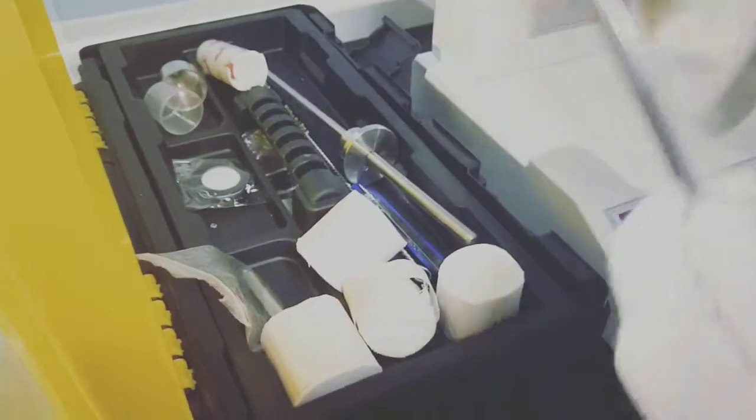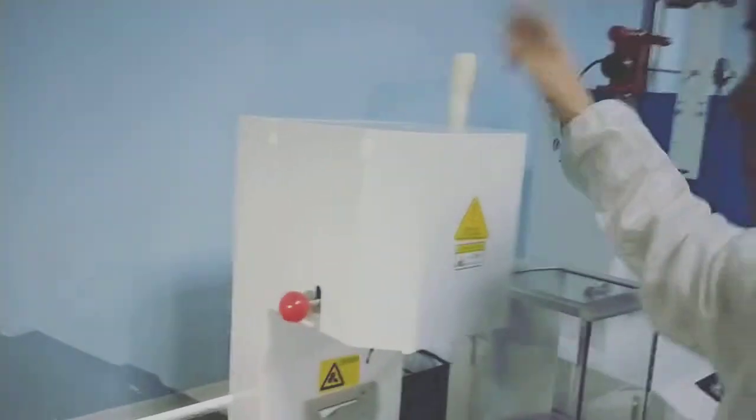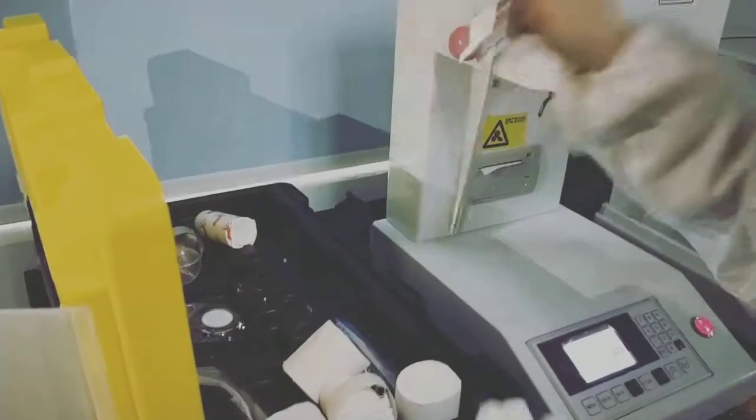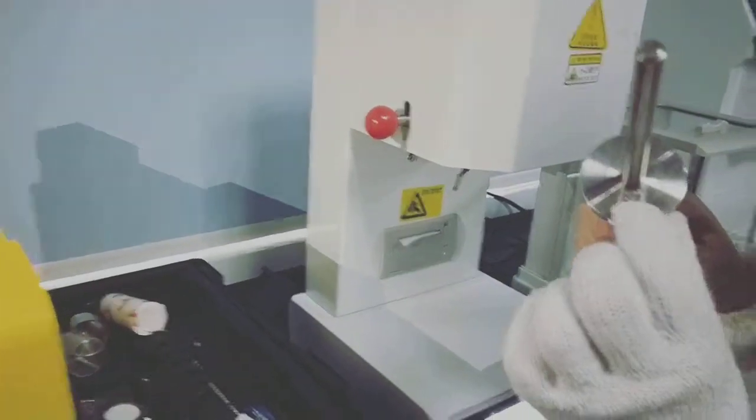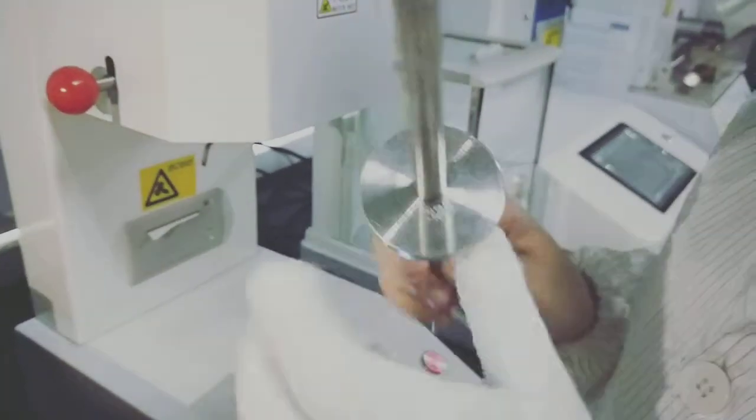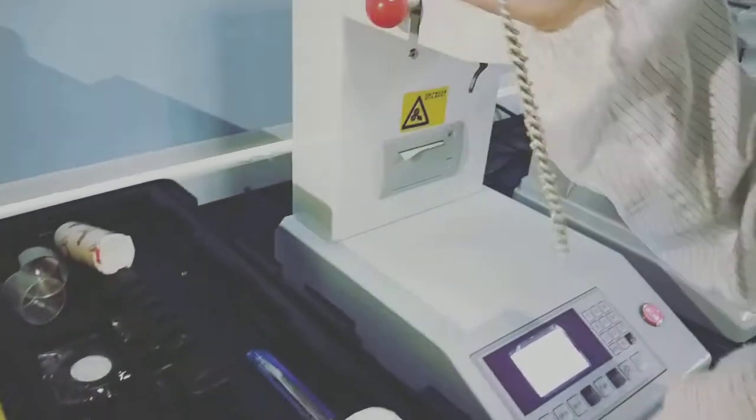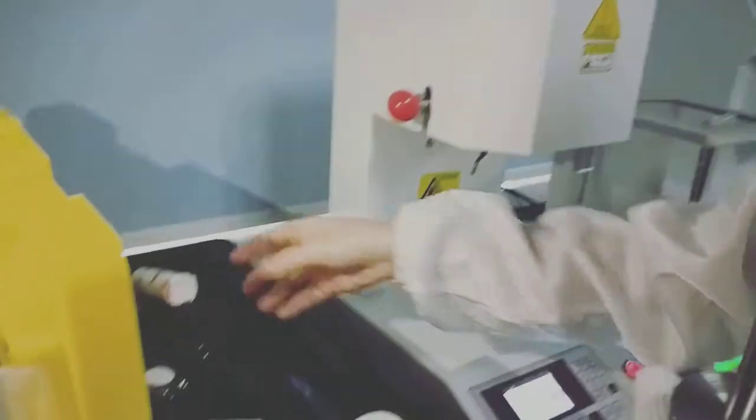This rod is used for cleaning the sample tank. And this one is used for adding weights. This rod already has 325 grams weight. And this is used for cleaning the sample tank too.